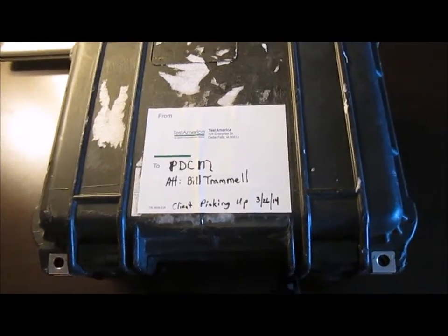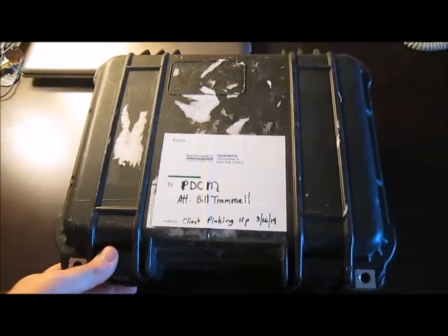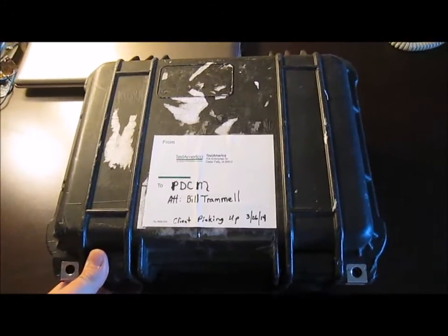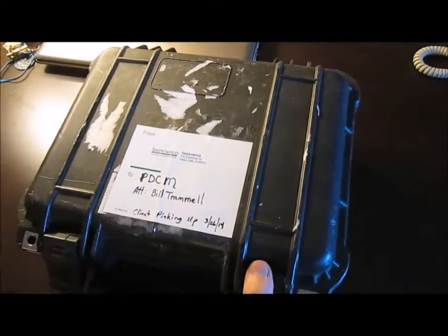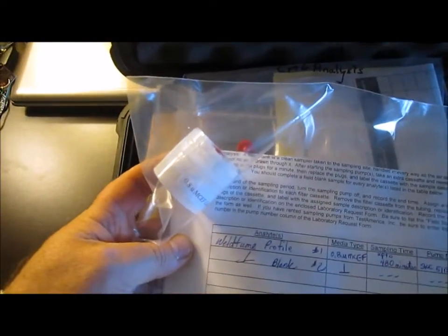This is just a short overview of what I do for testing, and this is generally the type of case and equipment I receive whenever I do any type of testing. These are just going to be two pumps for this test, and as with all things the paperwork comes in marked. In this case we will be doing a general welding fume profile on one.